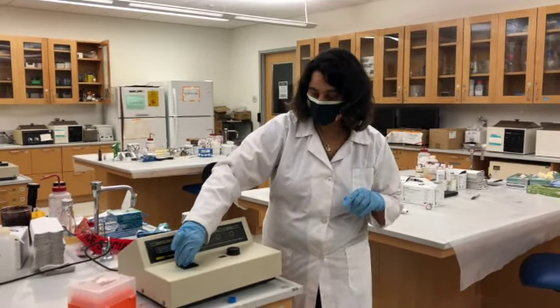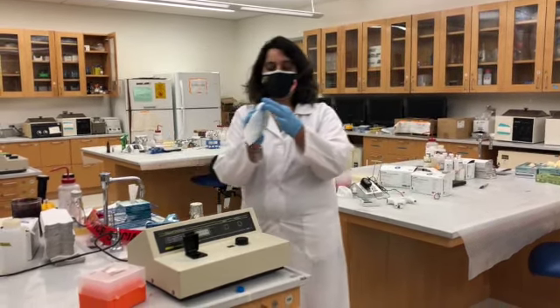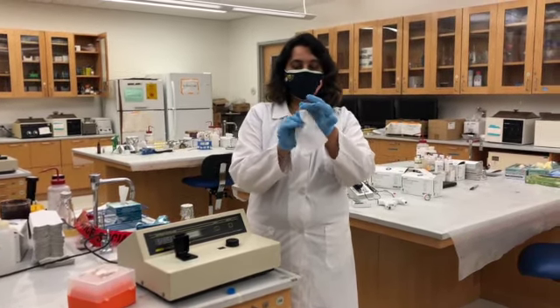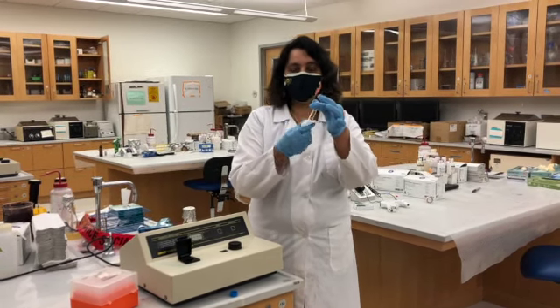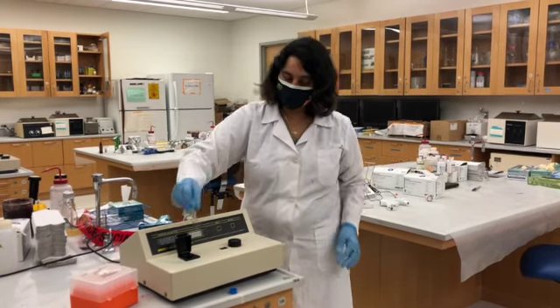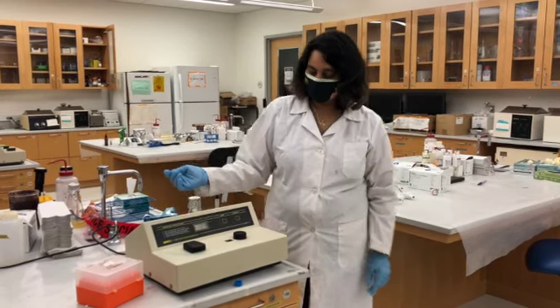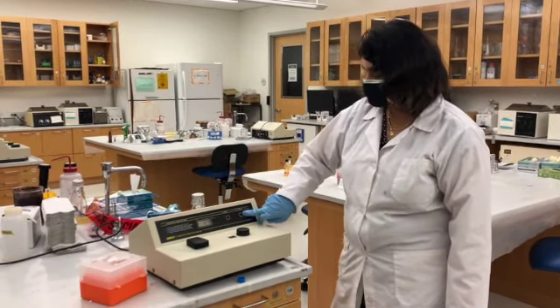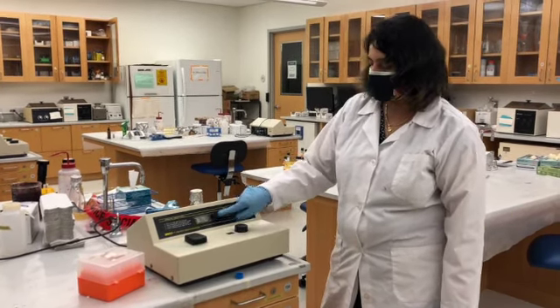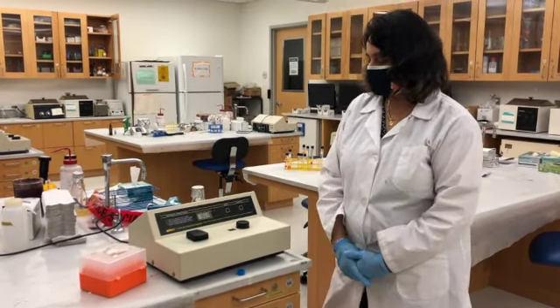Before you put the cuvette inside, oh, I forgot to mention something. Always make sure you're wiping the surface so there are no oils or any other marks from your gloves, because that would interfere with the absorbance. So make sure you clean the cuvette, press it in gently, and close the cuvette holder. And now you need to hit this button that's right next to the mode button. It says BLA, so we understand that the machine is blanking, and don't touch it, it's blinking.